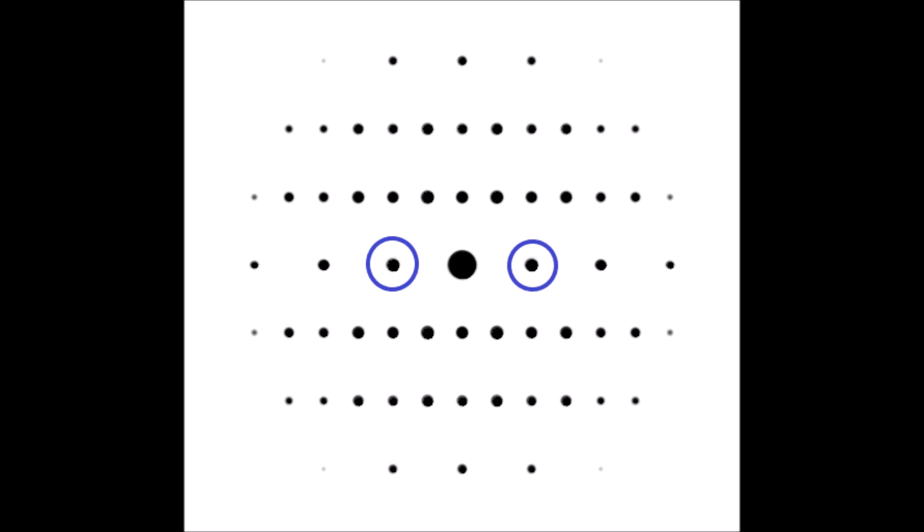You want to be very precisely aligned with the zone axis because that's going to give you the best high resolution image.